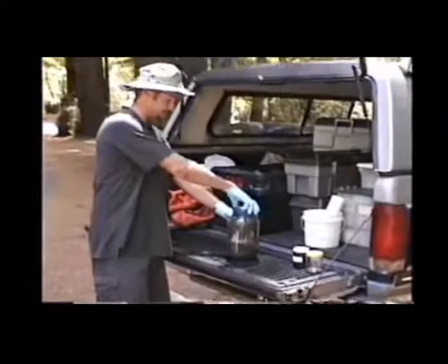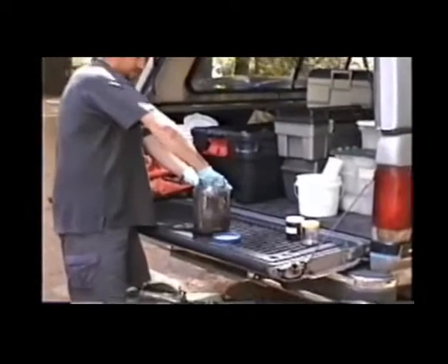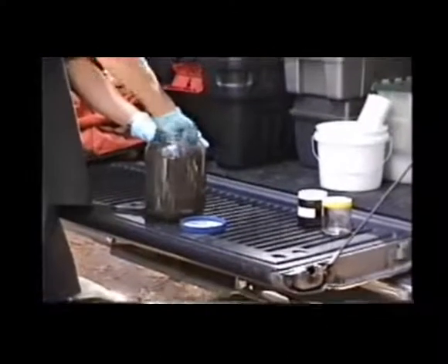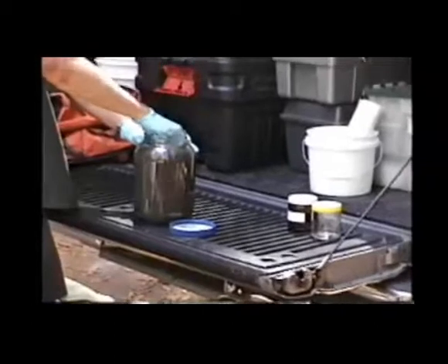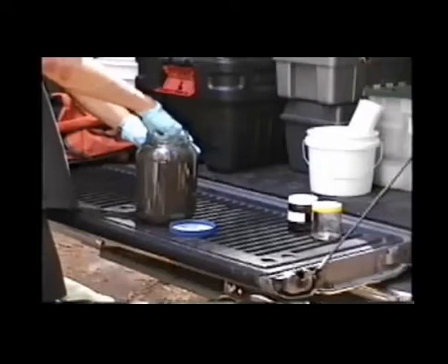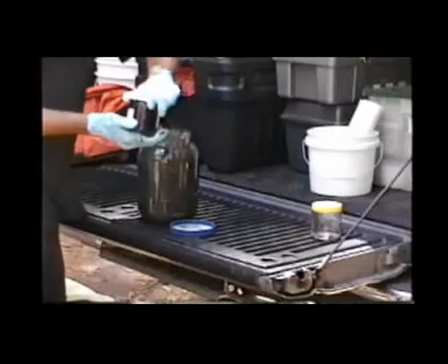To do that, we will properly stir the sediment. Making sure to get everything off the bottom, off the sides, and trying to homogenize as much as possible. And we have to remember that we have to act quickly as soon as we start aliquoting to sample jars, as the finer stuff will start to settle out as soon as we stop stirring. And then get our sample jars ready.